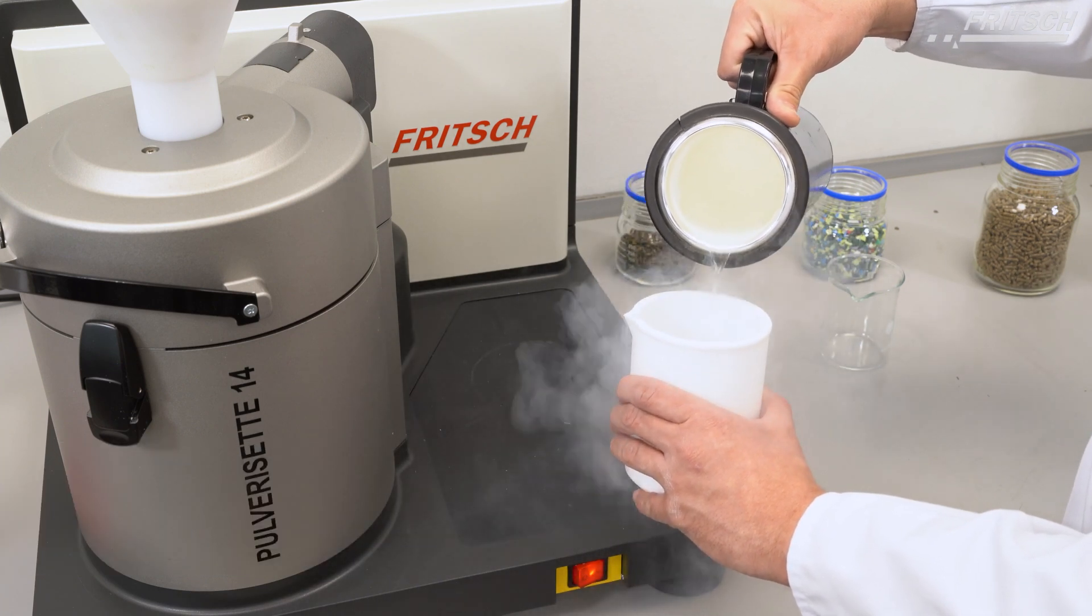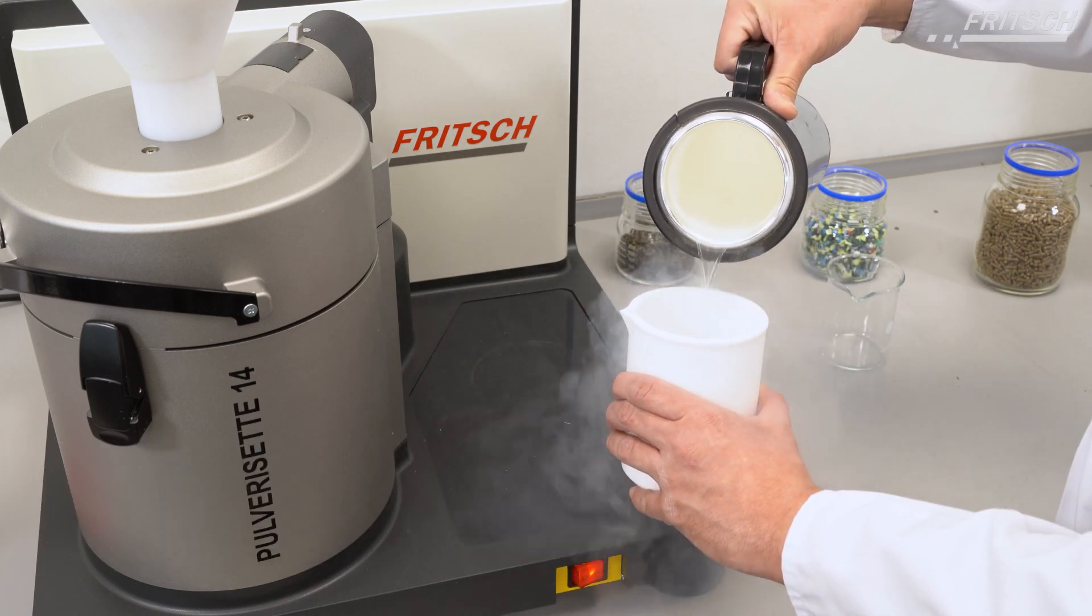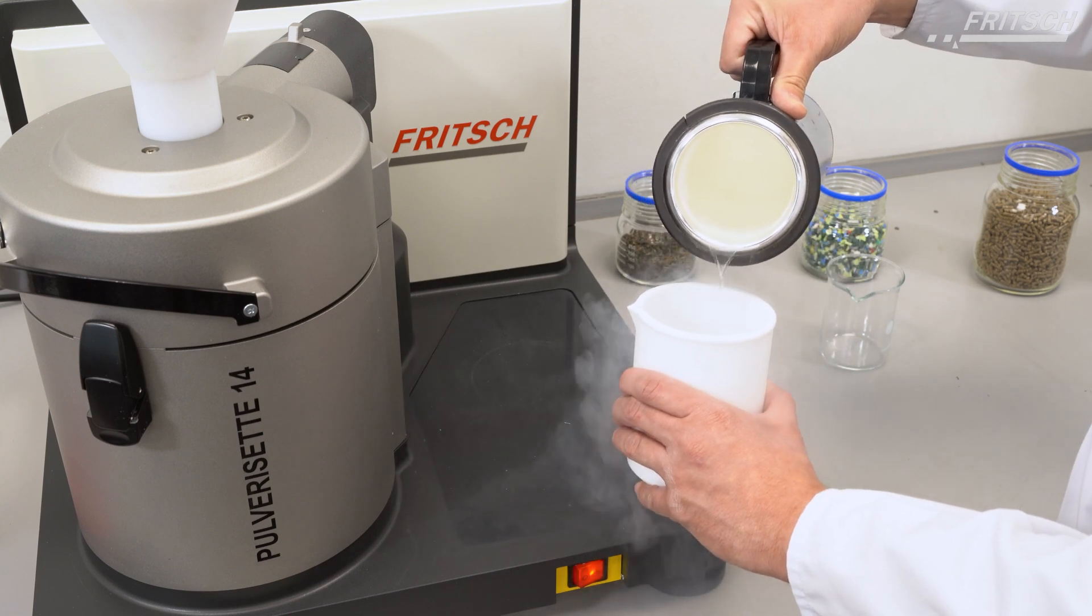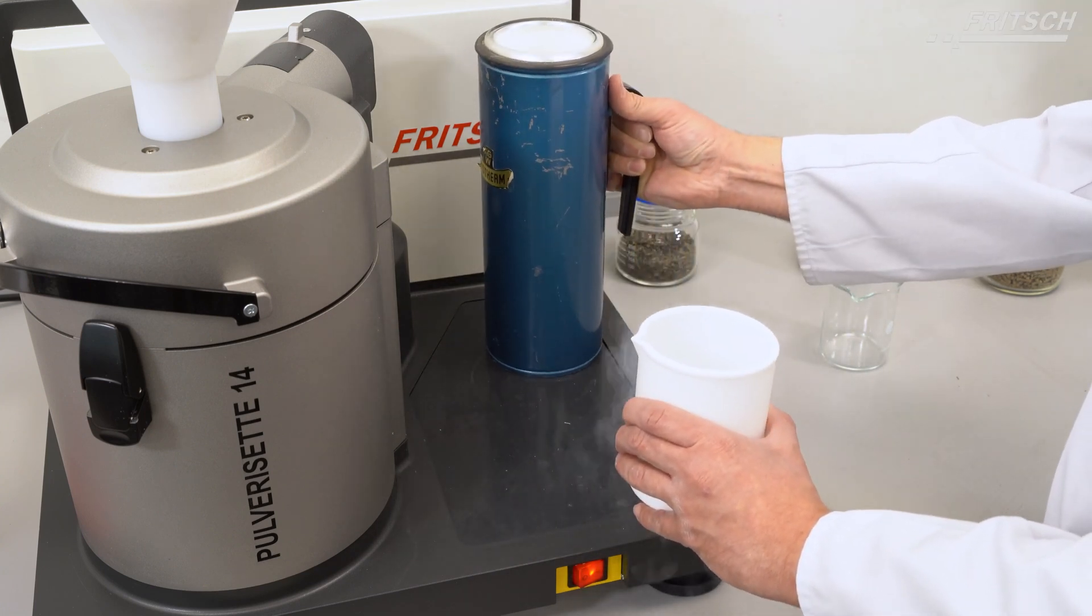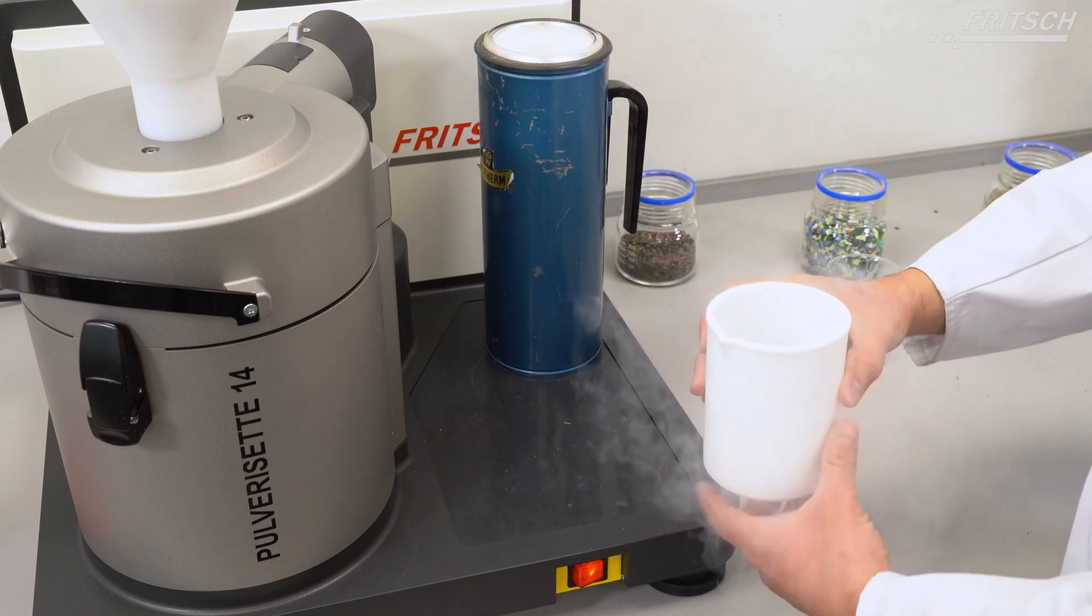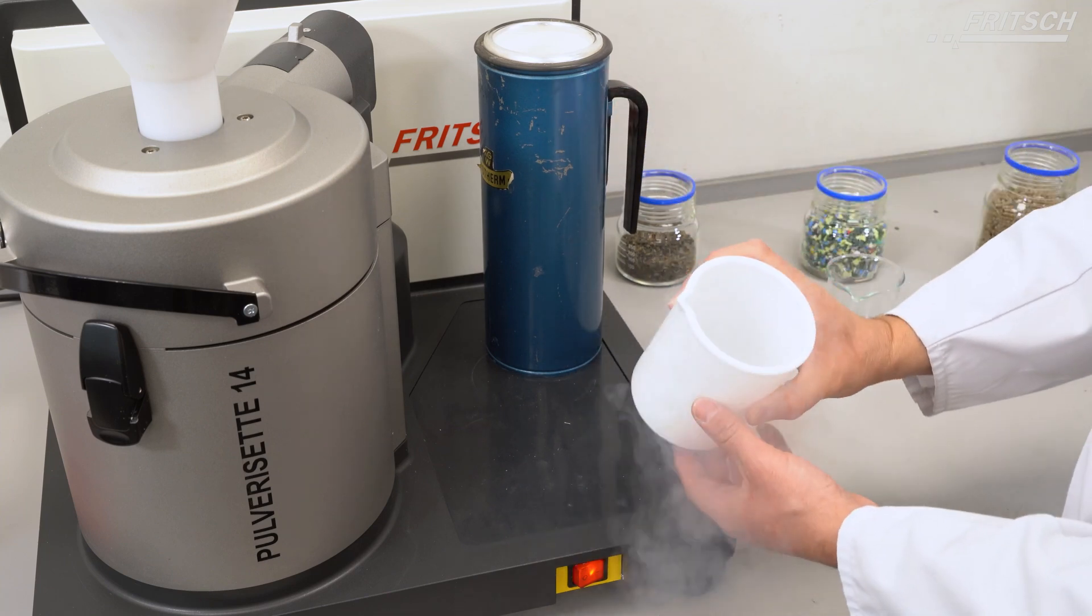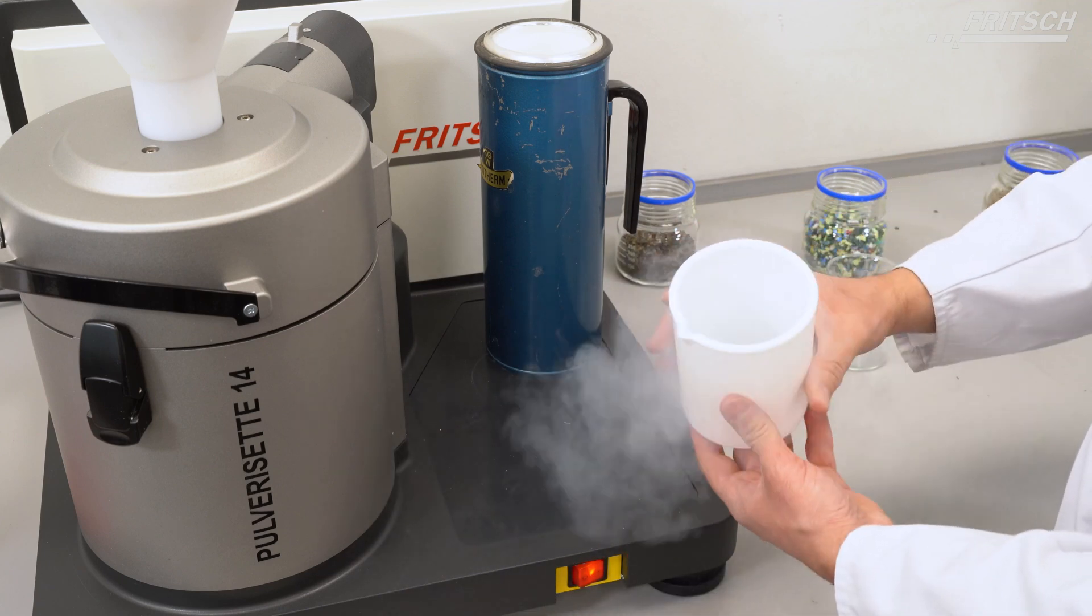Because of the low density of this plastic sample, it might happen that these particles will jump around all over the surface. It is necessary to choose a deep vessel.